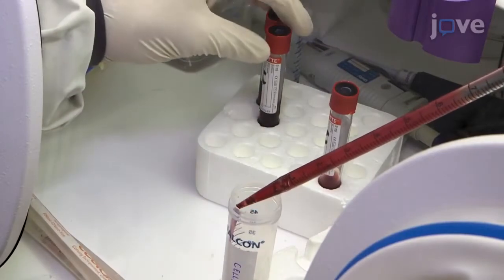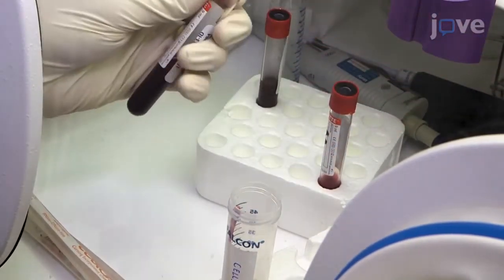Using the blood collection tubes, combine the red blood cells in a conical 50 mL tube.